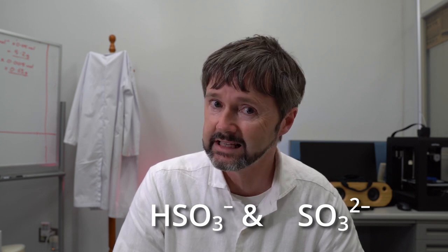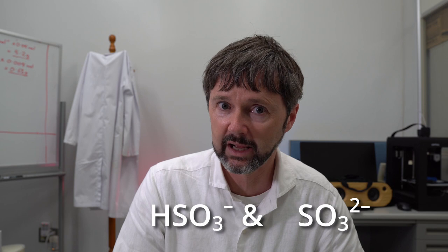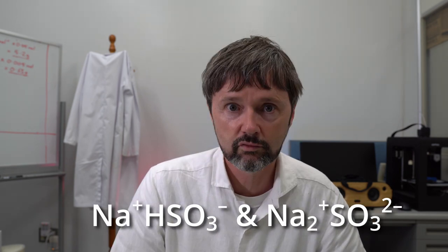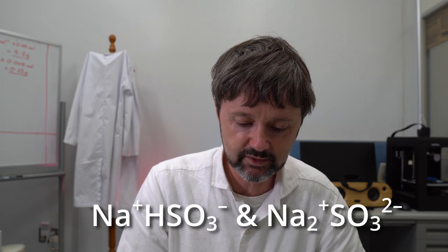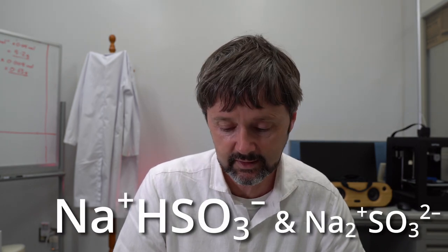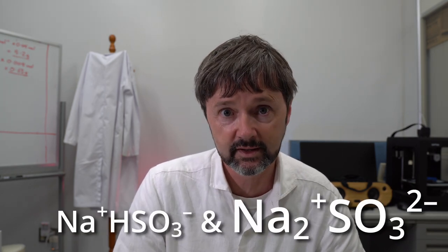Now you'll see that these ions have negative charges on them, so I need some positive ions to balance up those charges. In this case, I'm using sodium. Alright, so I'll be using sodium hydrogen sulfite (NaHSO₃) and sodium sulfite (Na₂SO₃) to make my buffer.